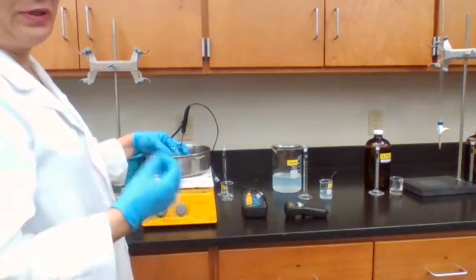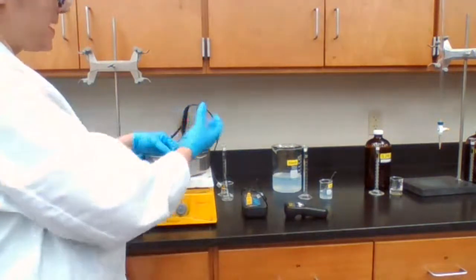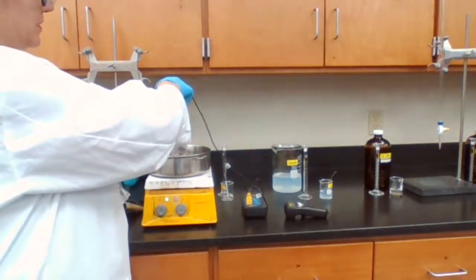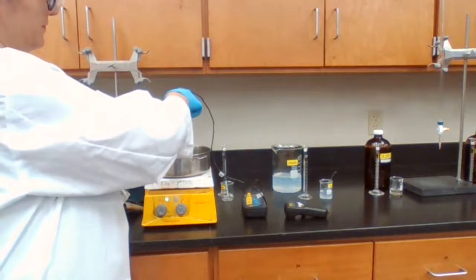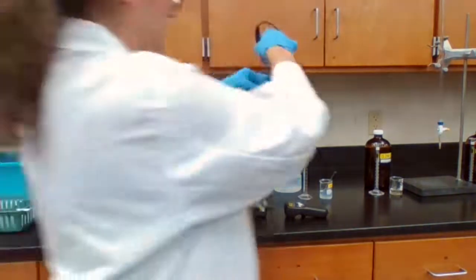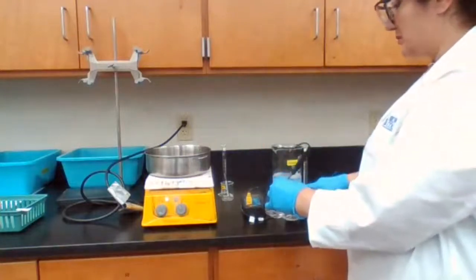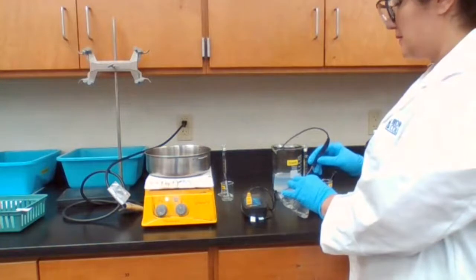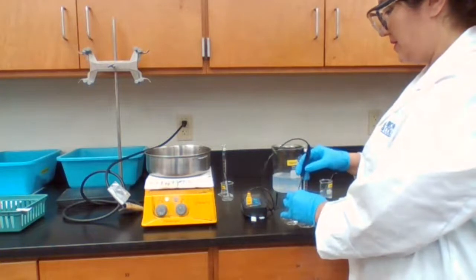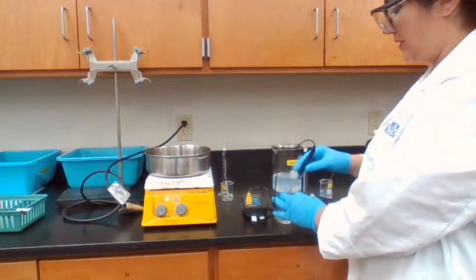The temperature for the liquid should be that much. When it's sitting there, if the thermometer touches the bottom of the pan, it might record a different number. So I have to lift it up, check the temperature, and make sure that it's higher than 45. Okay, now it's higher than 45. I'm going to wait until it reaches 45 for a more accurate measurement. So 44.9 or 45, I take either one of them, but as soon as it reaches 44.9, I mix the two.